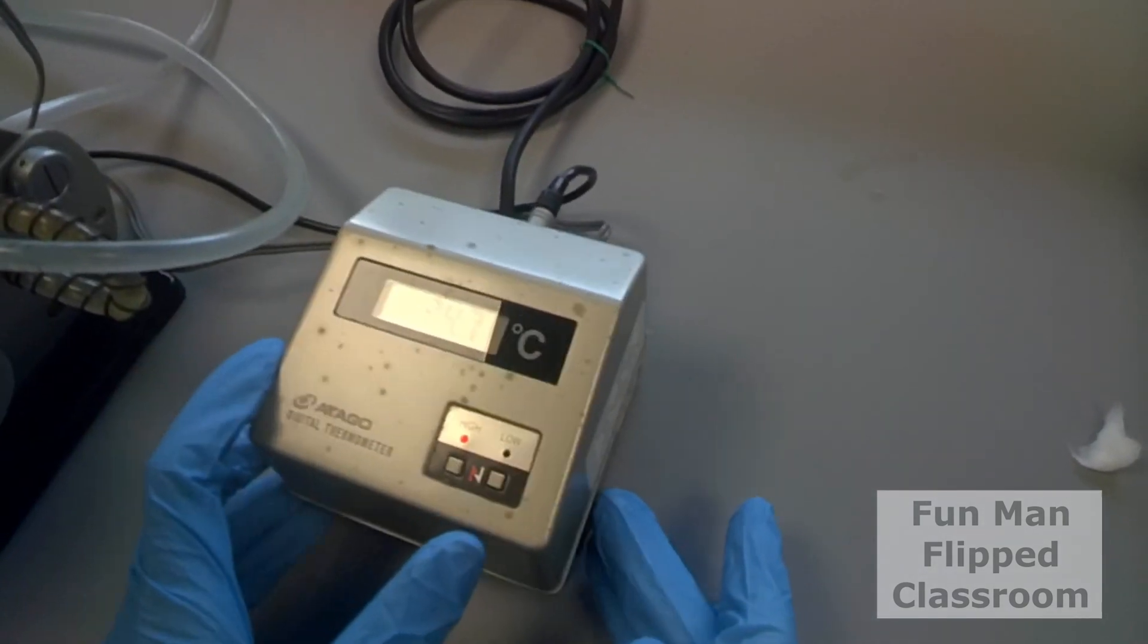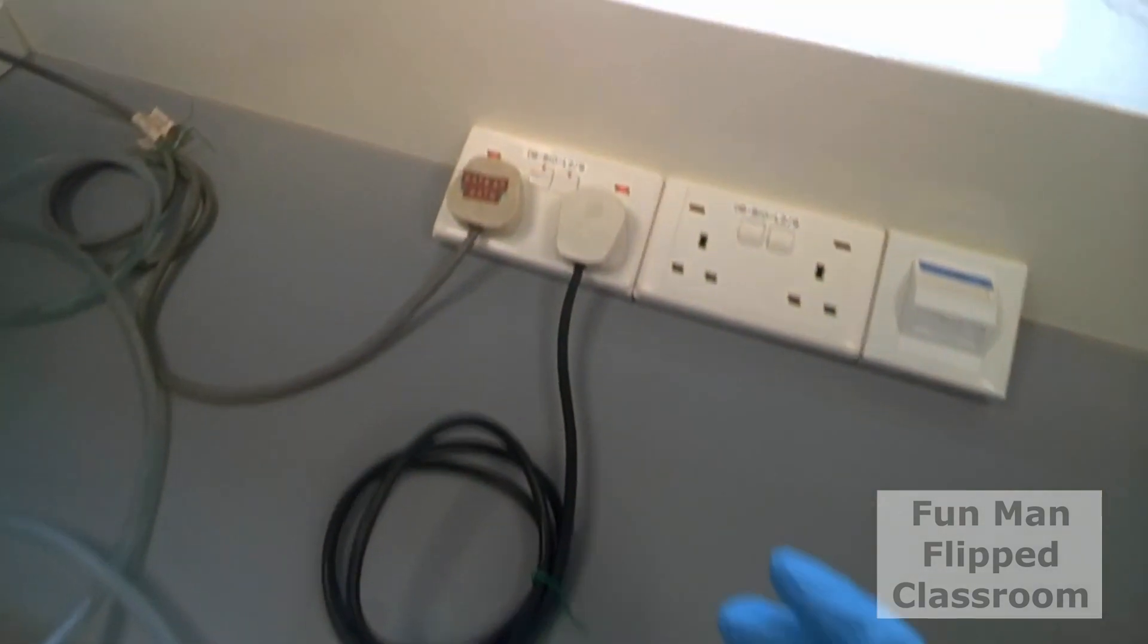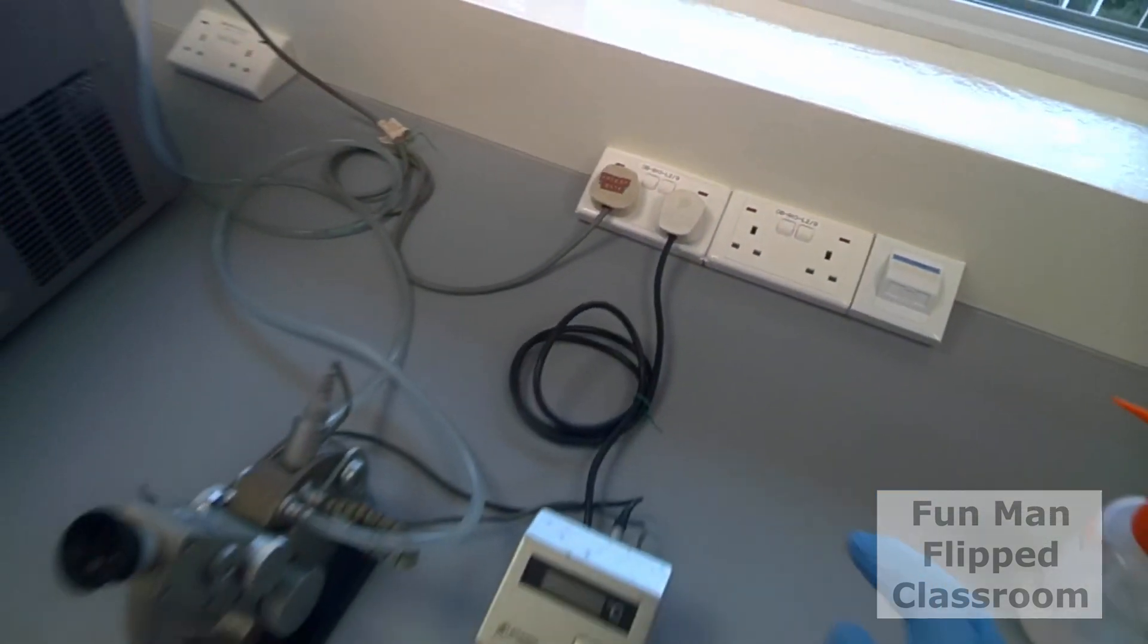Turn off the power switches and turn off the main power supply. That's it.